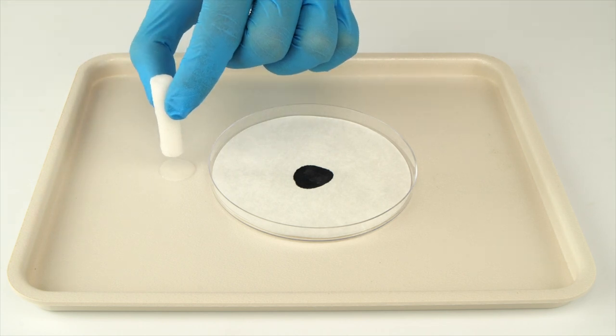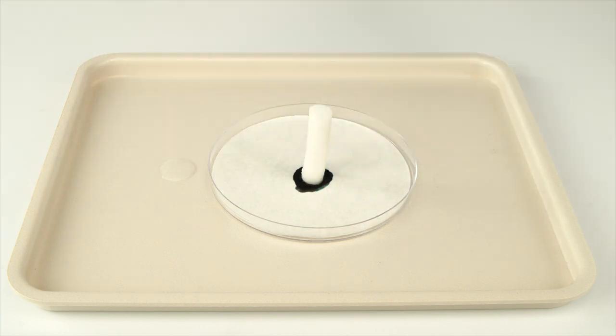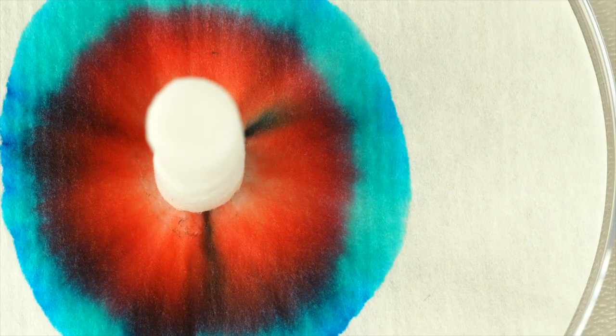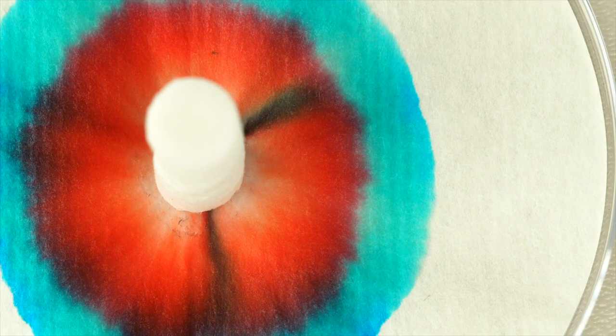Set the damp cylinder in the center of the black circle. The black circle will separate into colored rings. You will get your final result in approximately 10 minutes.